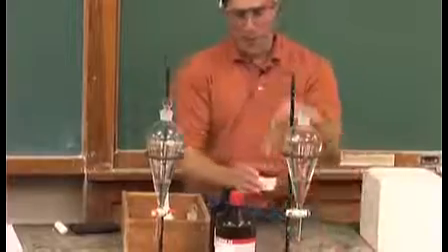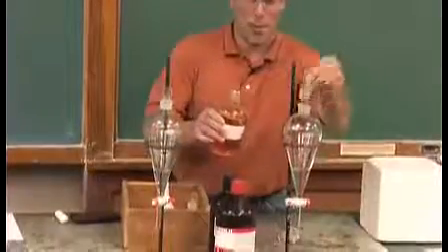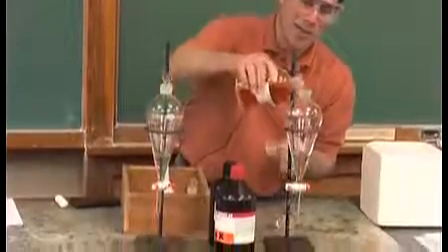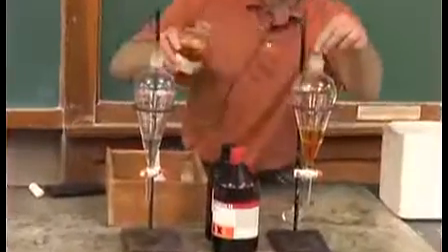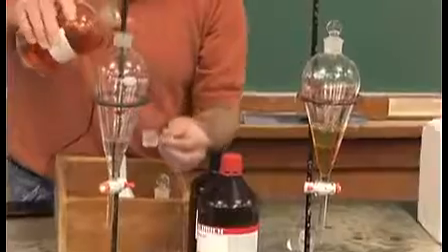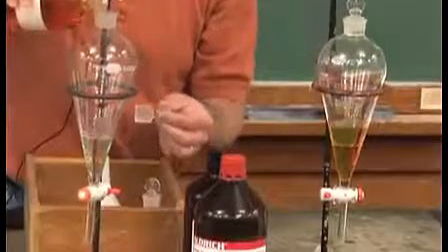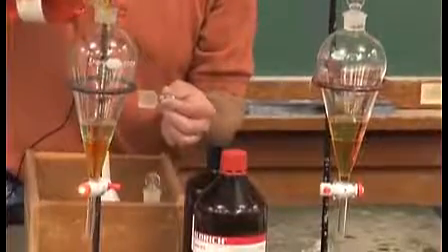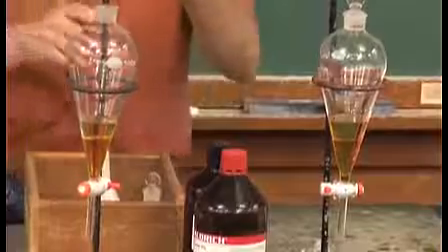And what I'm going to do is add a little bit to each one of the separatory funnels. So I'll add some brominated water to this one, and I'll add some brominated water to this one. So one of these will have a reaction, the other one won't, and we'll see a nice color difference.